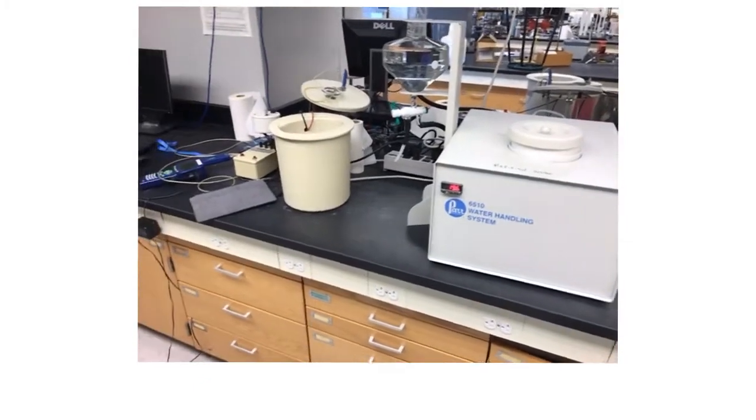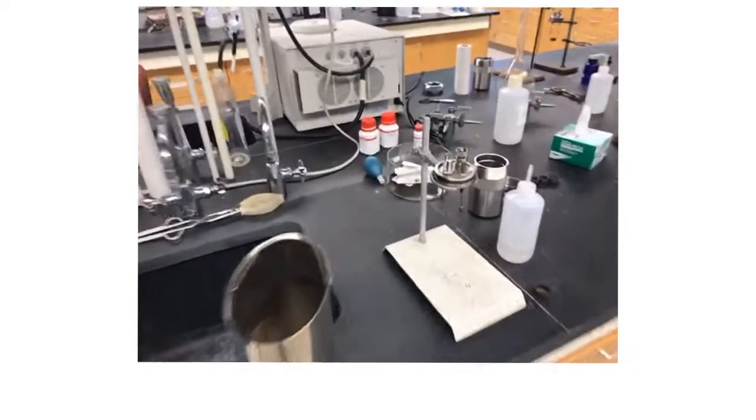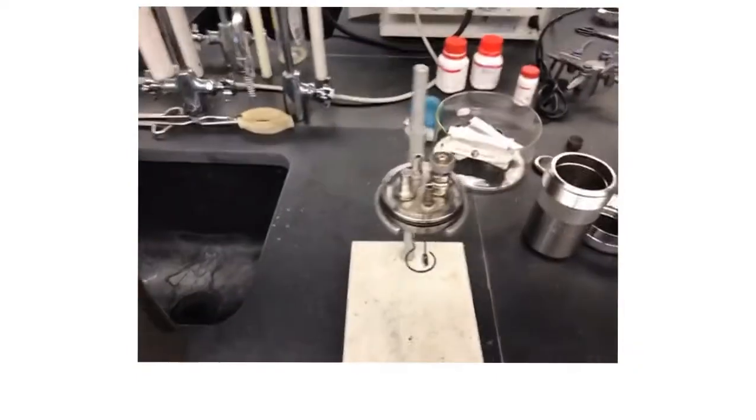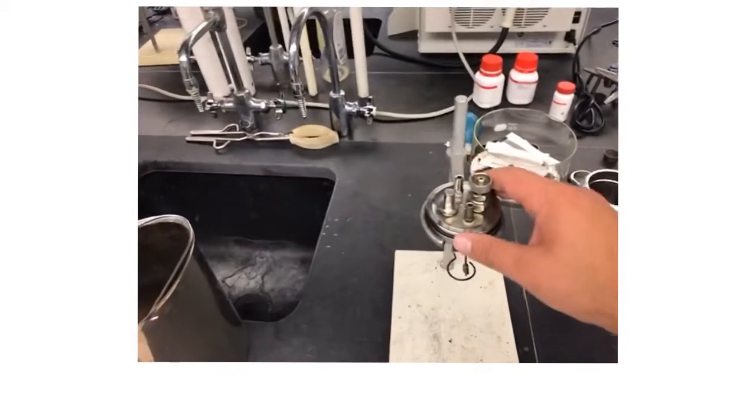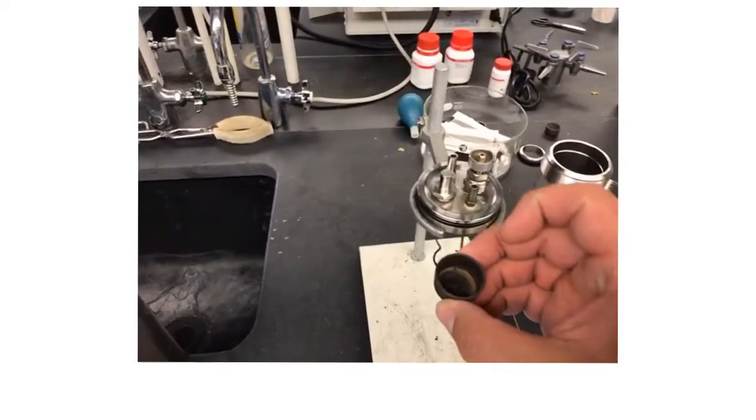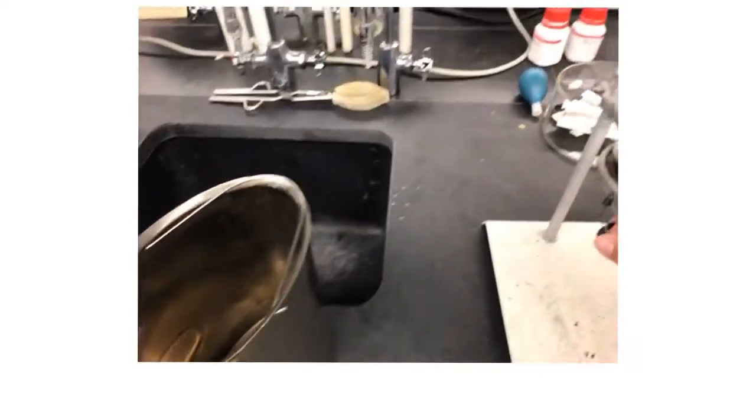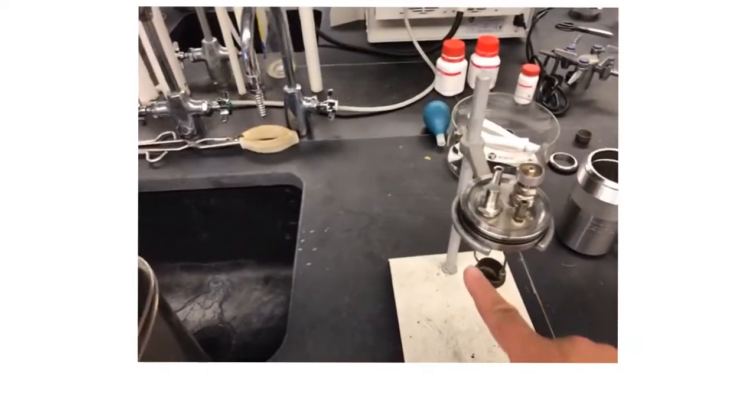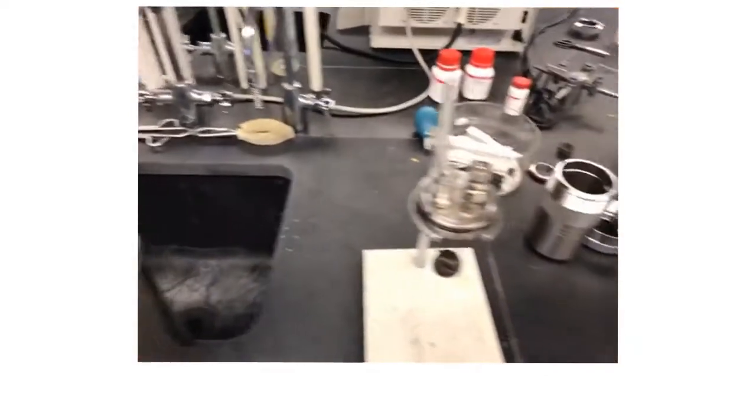Hello and welcome to an introduction to the calorimetry experiment. I have a few pieces here that are important. We have our calorimeter where we can put our sample inside a little crucible, and then we could put our sample here, lead a wire to it. We'll talk about that in a moment.